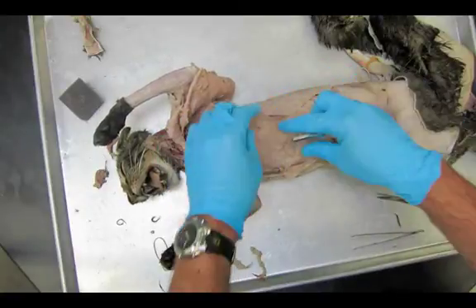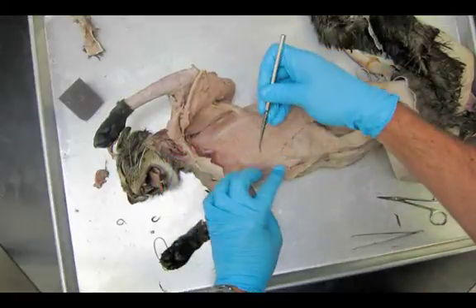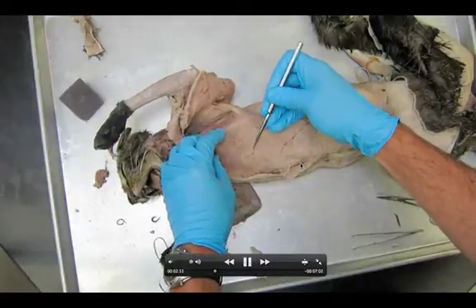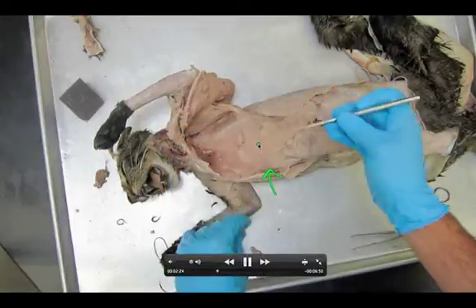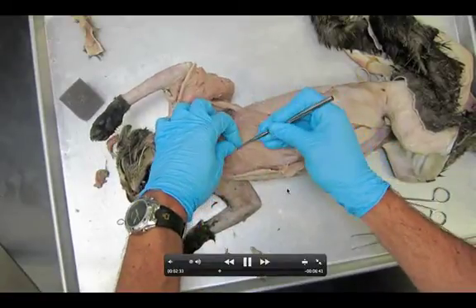Once you get underneath all of this, you need to remove some of this white fascia and pinkish stuff that's covering everything. The first muscle you're going to find is this one that runs all the way down with certain breaks to it. Any ideas what that might be? This is going to be your rectus abdominis. You can actually find the rectus abdominis way up here — you already saw it down under the flap. I'm getting under it right there. We're going to leave it like a book page, still attached to the midline, and just get under it. Rectus abdominis goes all the way down.